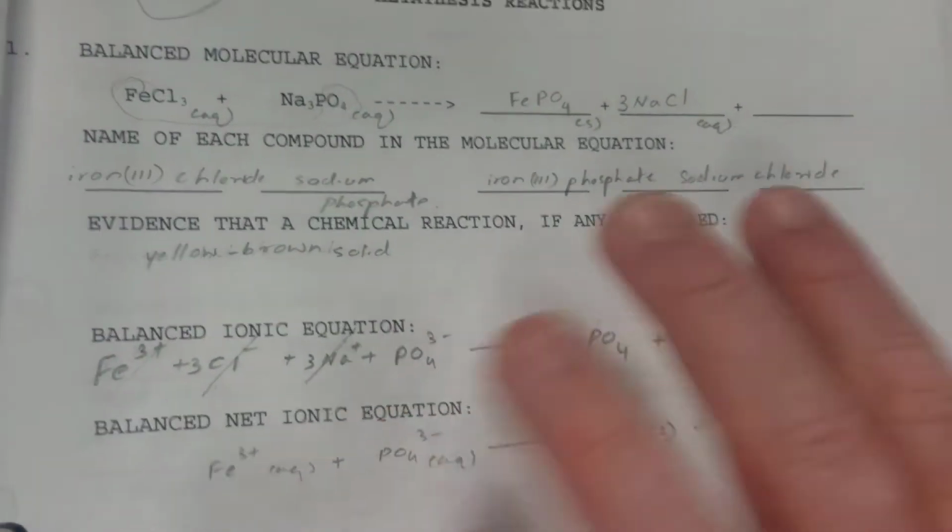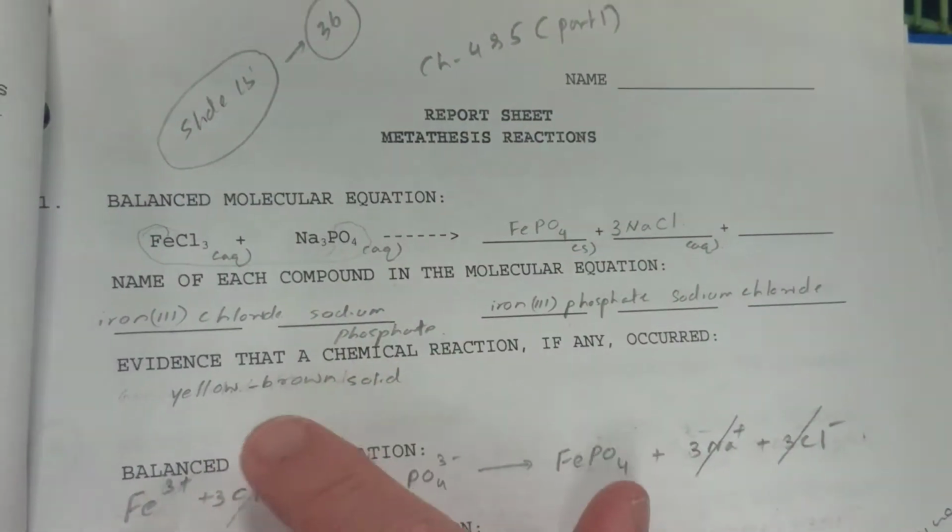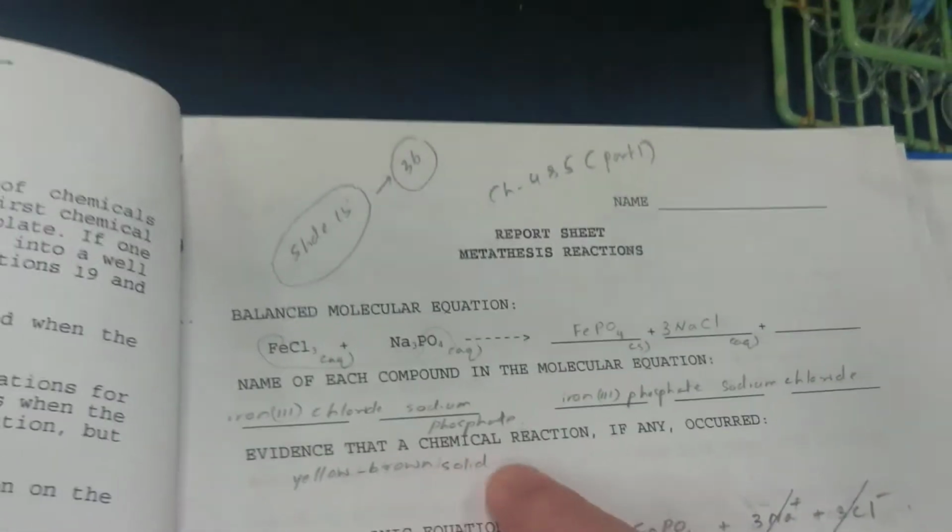We'll just go over here and look at it, and we have this written out, but you'll see how that works. You're not supposed to look at all this, but what you can do is write down here what you observed.